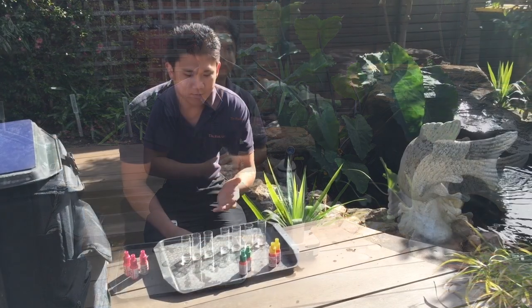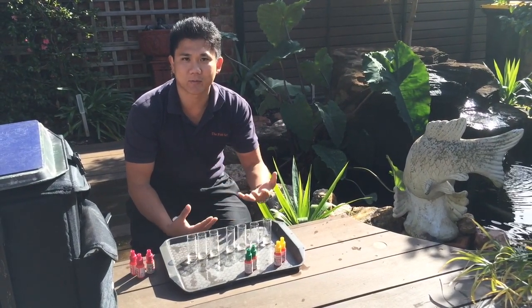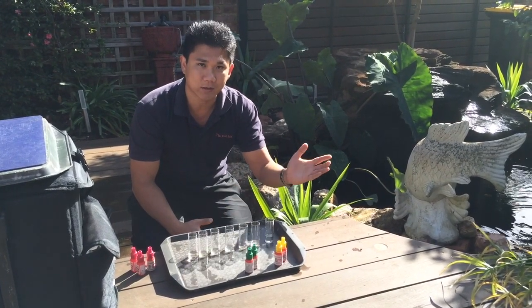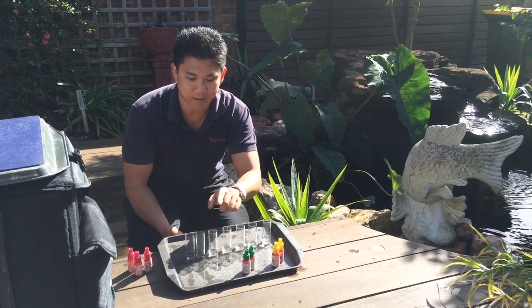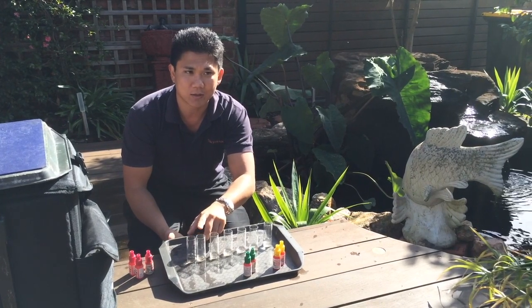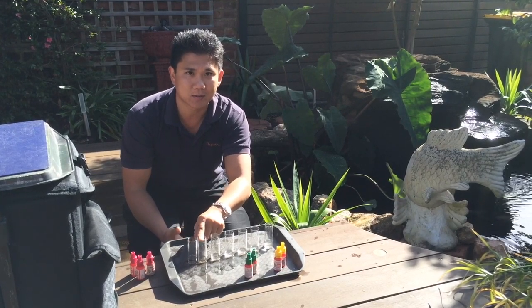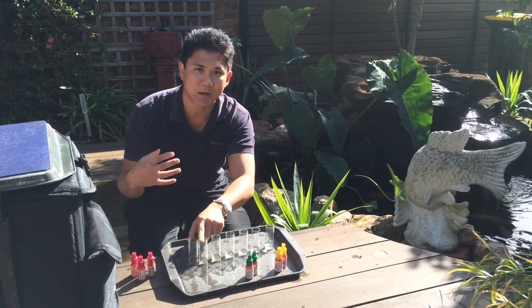As part of the standard diagnostic test of water quality, I'm testing ammonia, nitrite, and nitrate — these tell me about the biological activity of the biofilter, making sure there are no problems. Then I'm going to test the pH to know whether the water is acidic or alkaline, which affects the fish a lot. Then we're going to test the buffering capacity of the water with the alkalinity test, which is KH. And we're going to test the general hardness, which is called GH or permanent hardness. With koi and goldfish, GH isn't going to directly cause disease, but it helps me know which drugs to use and at what dose rate.